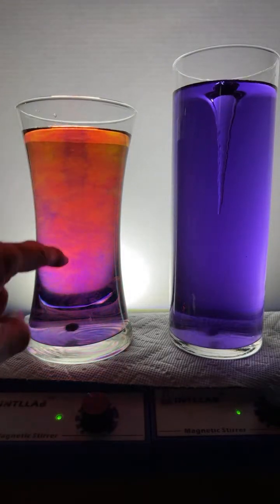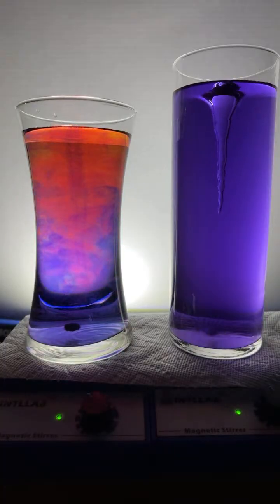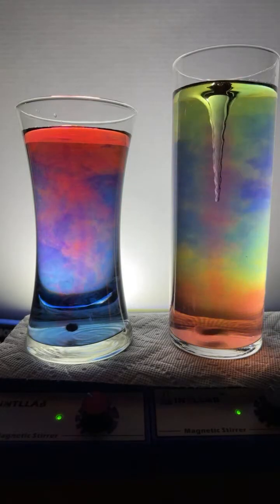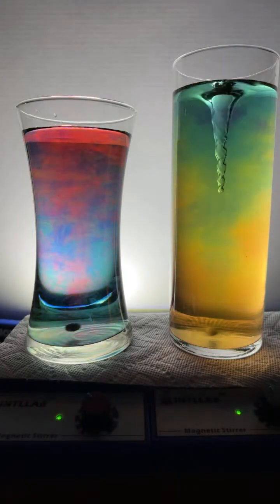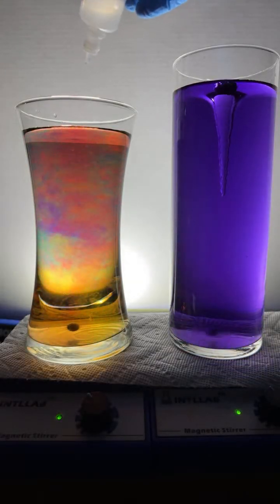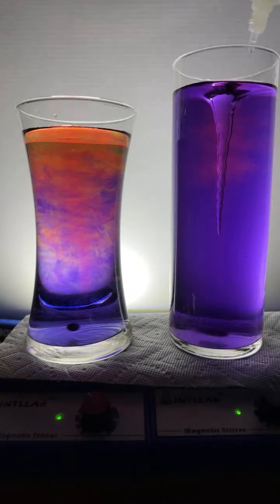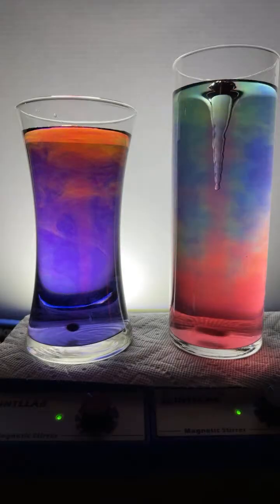What's causing the whirlpool? This is on a magnetic stir plate. What would pH 0.5 acid do? At this point, it depends on the acid. Different acids do have different chemical properties. The common chemical property of all acids is that they donate protons. And the pH basically tells you the concentration of protons in the solution. The more protons you get in solution, the more those protons can do their work.